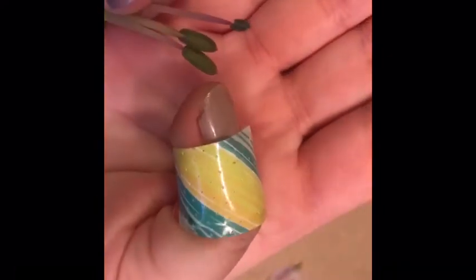So these 2 parts are actually the same on this flower. What makes them different is this has a protective covering on top, and I'm still trying to figure out what that means. A couple of my resources say that it's just protecting the rest of the pollen, so that way eventually those kind of casings will fall off and reveal the same thing here.